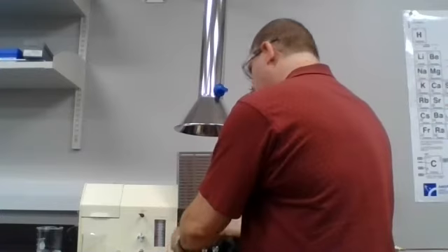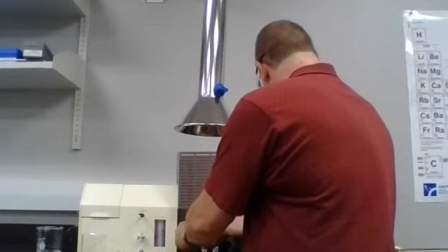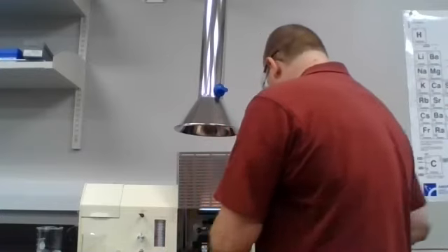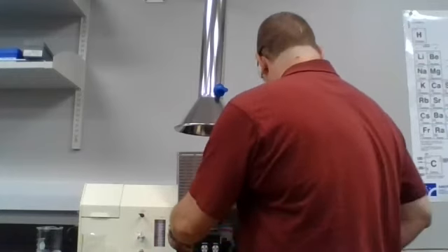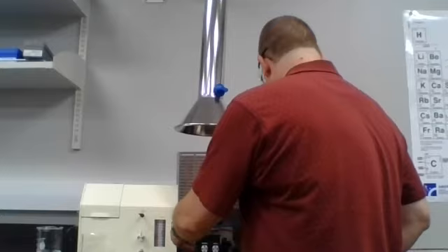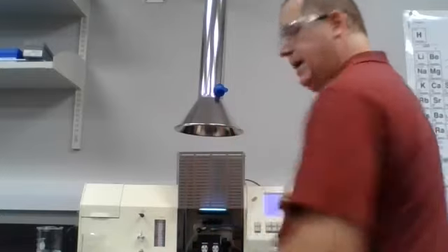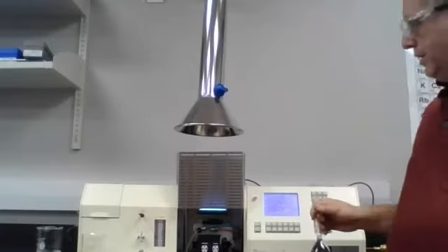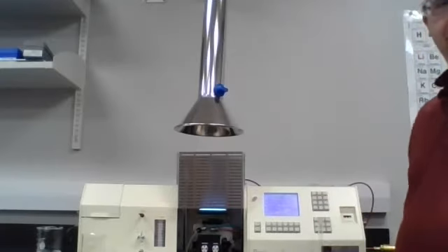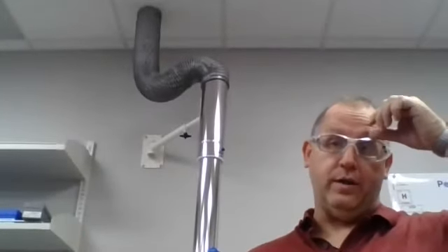The 2 measures at 0.065. And the 1 measures at 0.031. As we can see, our iron is definitely within that range. I will take a look at the video and see if I need to edit it or whether we're good where we are. Either way, I will add the data on another screen here in just a couple minutes.